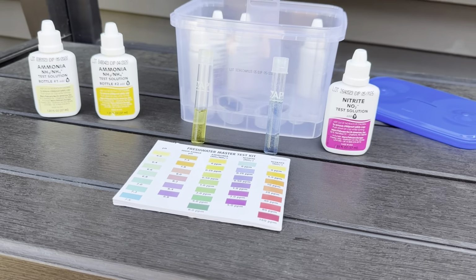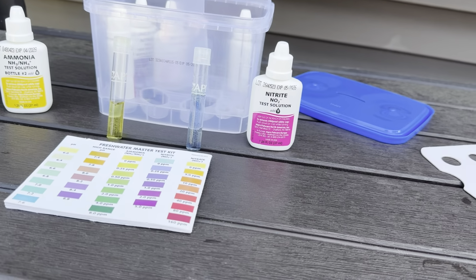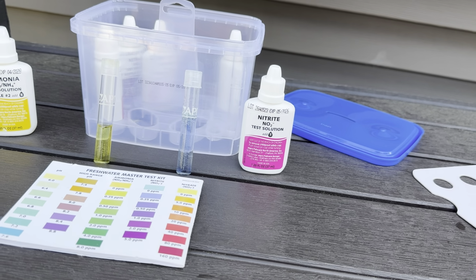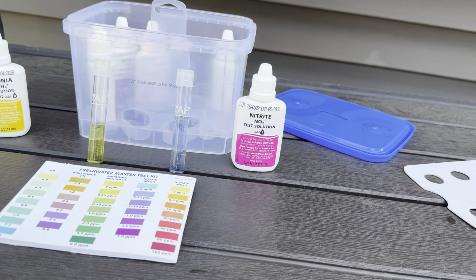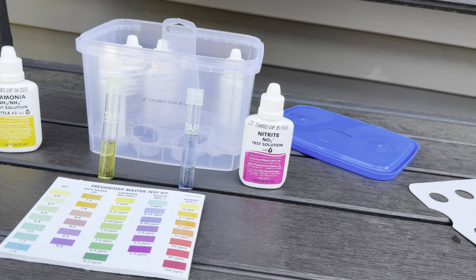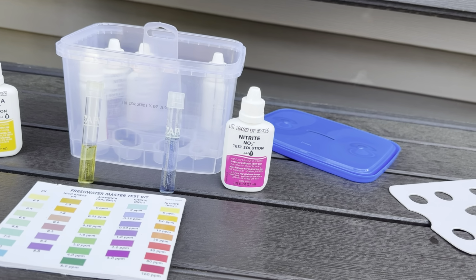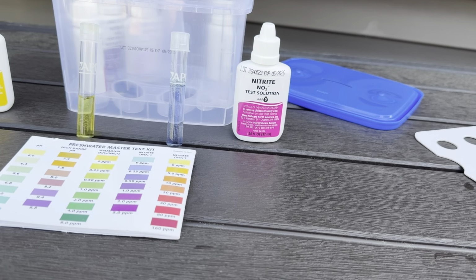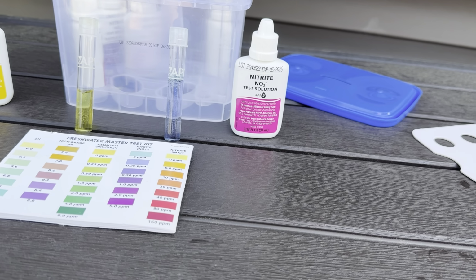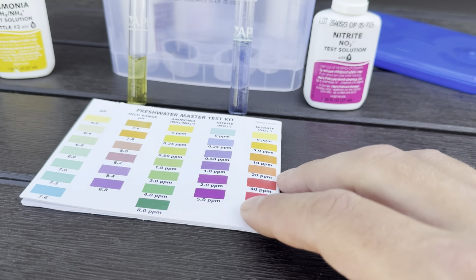All right, so good news to report. So after the roughly 50 or 60% water change, and then like I said, I added tank water in there, and I have all the aeration in there now. I have the waterfall, the fountain, and then 2 aerators going. These are my levels right now. So did this earlier today, and now I just checked it again, and this is looking so much better now.